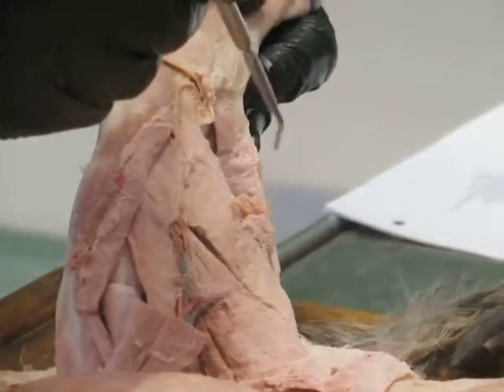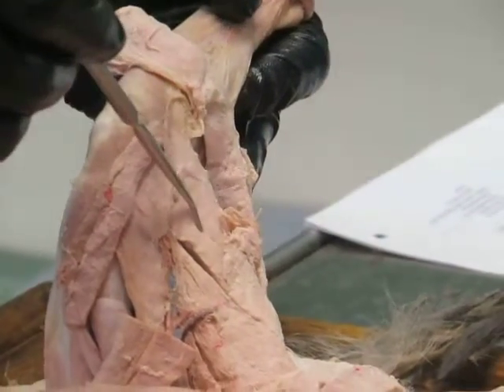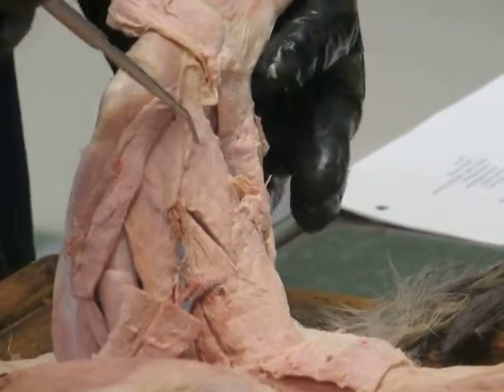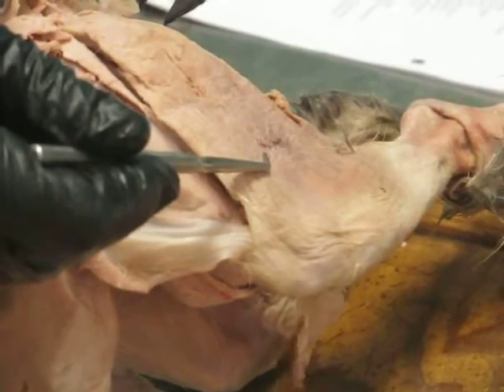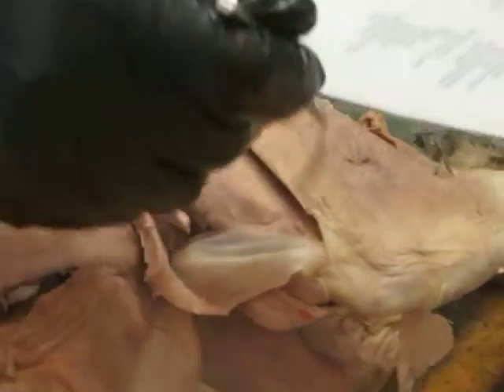Okay, so semitendinosus, semimembranosus, part of the hamstrings group. There's three parts of the hamstrings group. These are the ones that are on the medial surface. More laterally, you see this big muscle here? What's that? Anyone? Biceps femoris. Mm-hmm. That's the biceps femoris. And then here we can see, just kind of poking out, a little bit of semitendinosus, and right there semimembranosus. Those three together are the hamstrings group. All have the same action. They're retracting the thigh and flexing the knee.